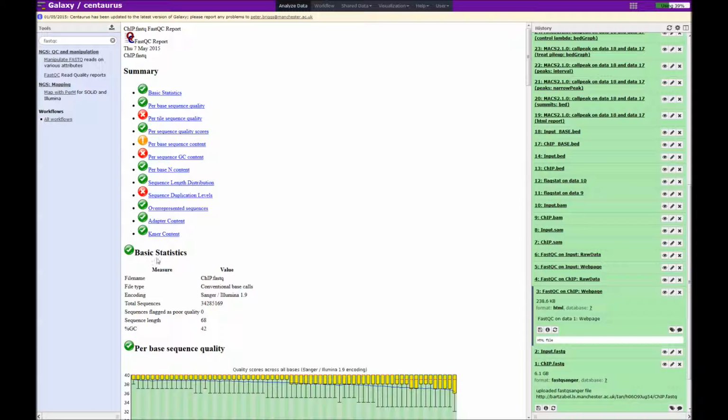The basic statistics section is useful in that it tells us how many reads are in the sample, how long they are, and what version of the fastq file has been used. Modern sequencers such as Illumina HiSeq and MiSeq sequencers will produce Illumina 1.9 or Sanger33 fastq files. For a comprehensive description of all the tests here, I would certainly go and look at the links that I showed earlier, as there is a very good manual and the video tutorial is very useful.